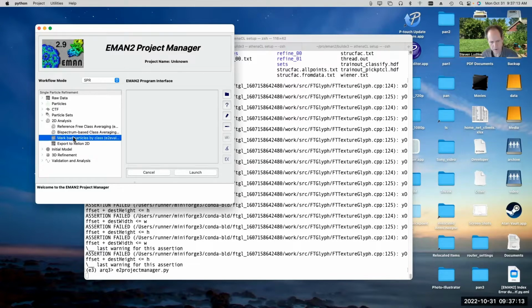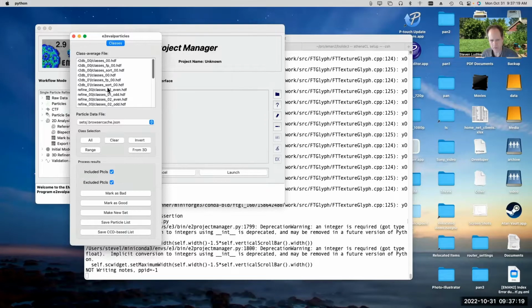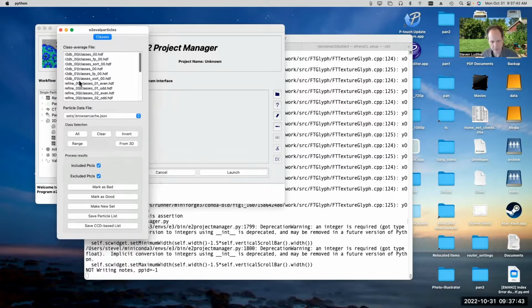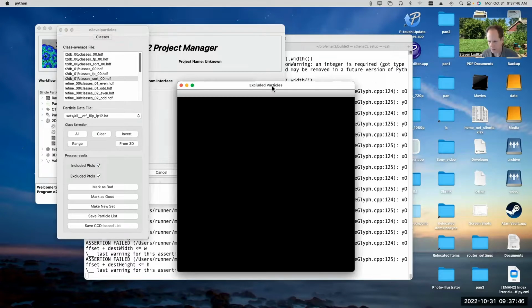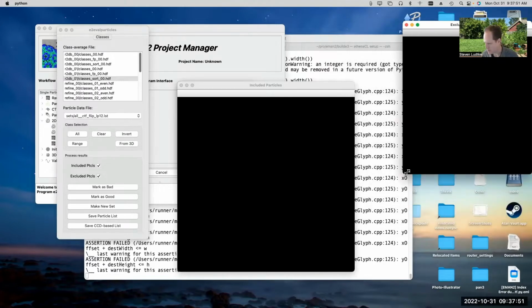2D analysis, mark bad particles by class, and that'll open up this interface where it'll show us all of the different class average sets that we've generated. This will also show us class averages that were generated as part of the 3D refinement process, which you could also do stuff with. But basically, this just shows you all the different sorts of class averages that were generated in the project. So if we click on this one, R2DB01, that's the reference-free, the unbiased class averaging from the second run. If I single click on that, that will open up several windows, which will start out on top of each other, so you'll need to rearrange them.